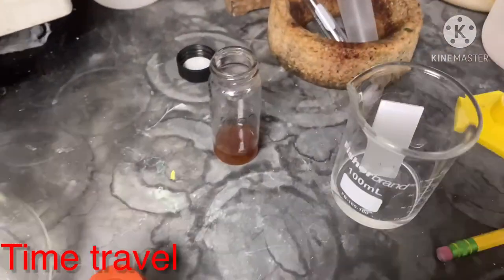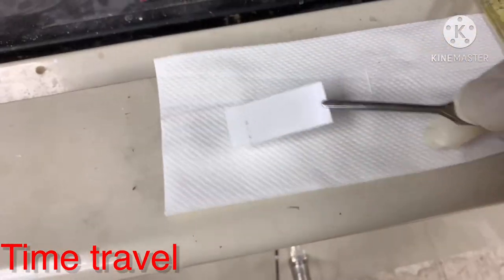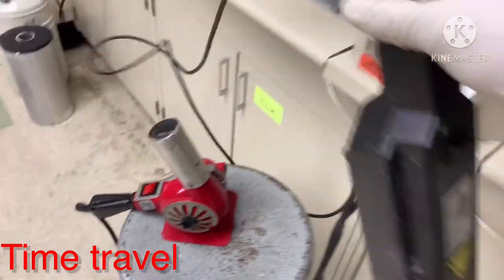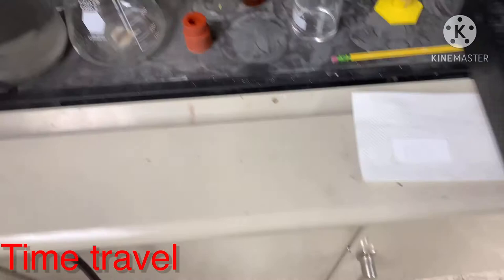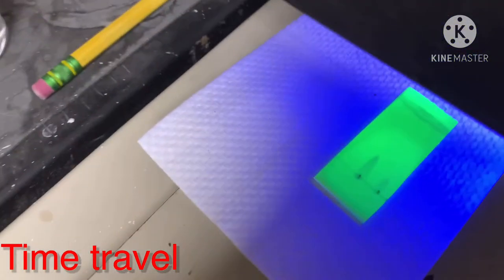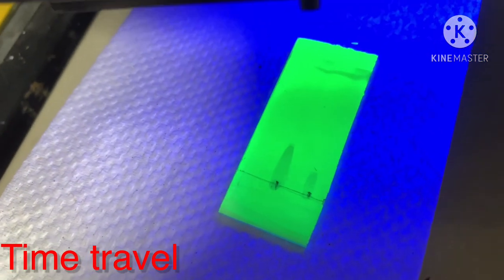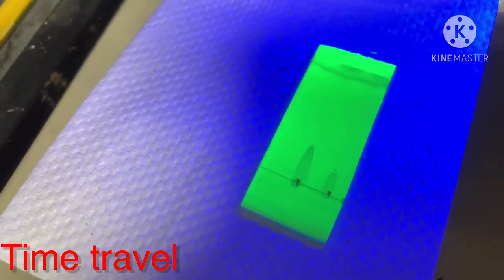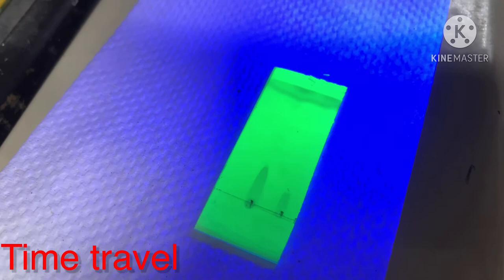Once I take the plate out with tweezers, I lay it flat on a paper towel to dry. Then I check the TLC under a UV lamp — at a certain wavelength, you can see the spots appear. I can see a bottom spot, which is my compound, and spots higher up, which are impurities. Since my compound is at the bottom with 4% acetone in DCM, for the column I will start with about 2% acetone in DCM to elute the impurities first, then increase polarity to flush out my desired compound.